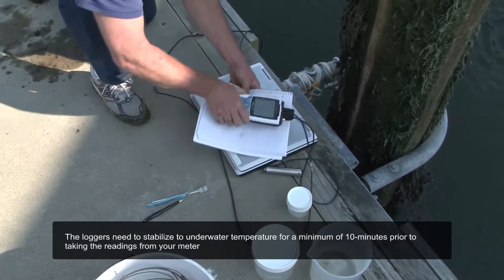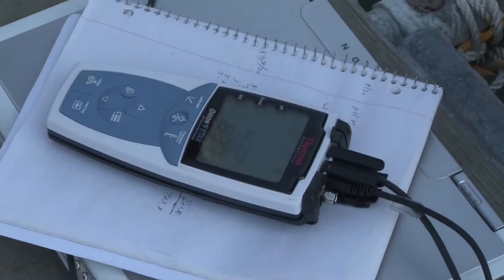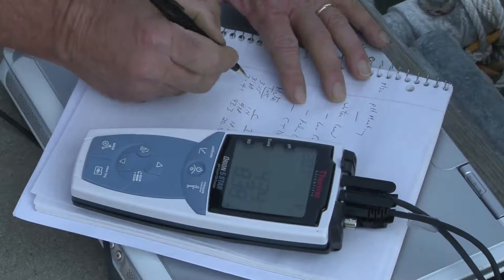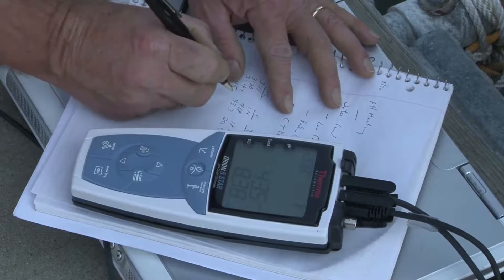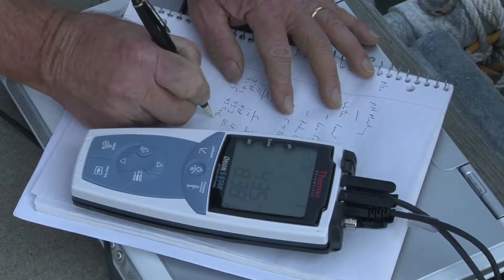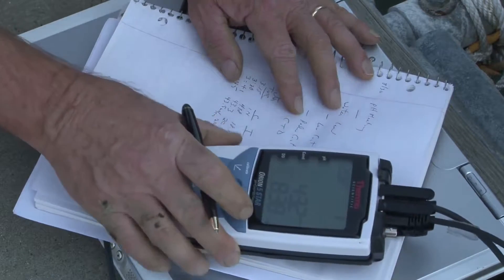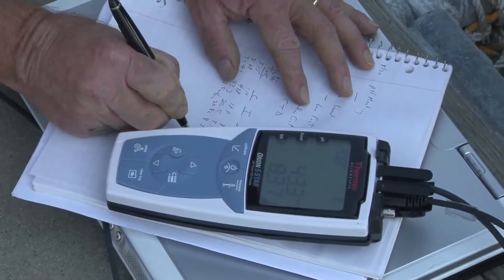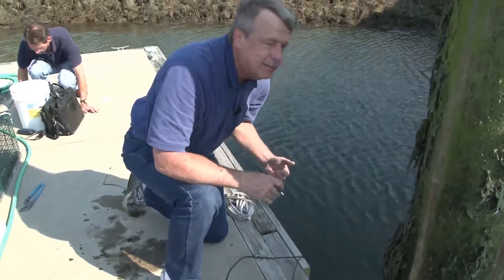Now we need to take a set of measurements again, because we need data for the beginning of the launch for both loggers — the U24 and the U26. I still have my meter with the two sensors in the water, the DO sensor and conductivity sensor. Recording the time: conductivity is 43.5 millisiemens per centimeter, temperature 20.8 degrees C, and DO 8.39 milligrams per liter. I now have the data for field calibration of the next measurement cycle.